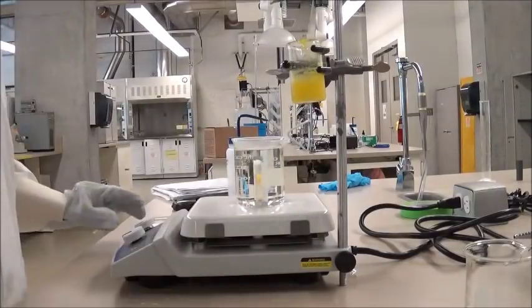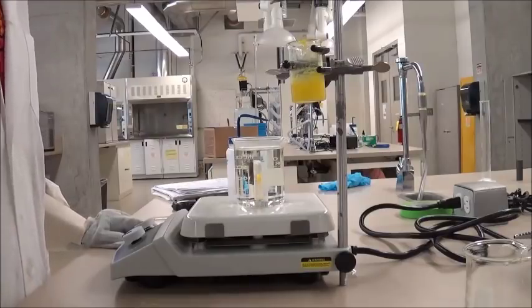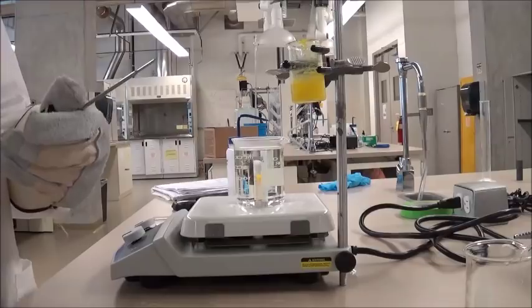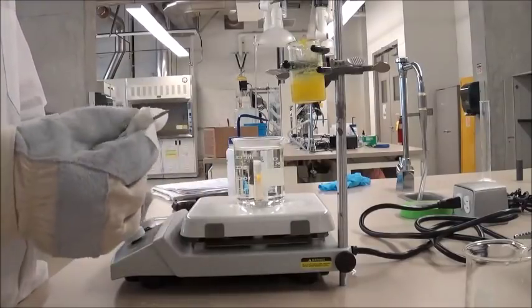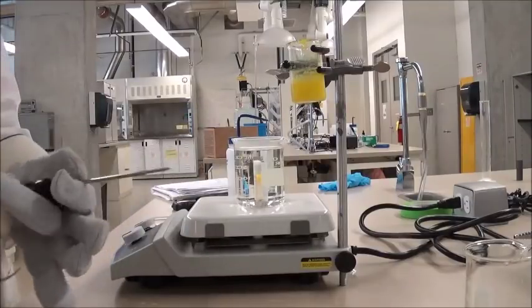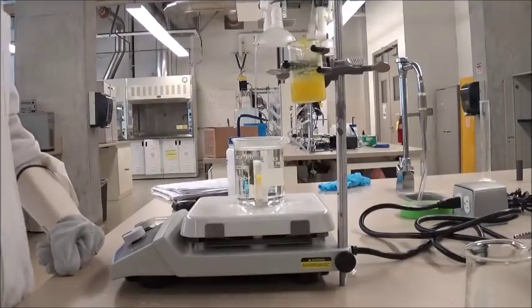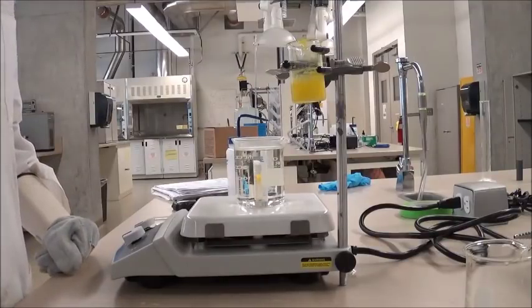Be sure to wear your heat resistant gloves, as the hot plate and the beaker are going to be very hot. Finally, you can also take a paper towel and clean the tip of the temperature probe that you used to get rid of any solution that's stuck to it. And then finally you should also dispose of the 9-fluorenone and unknown solid into the specified disposal container.